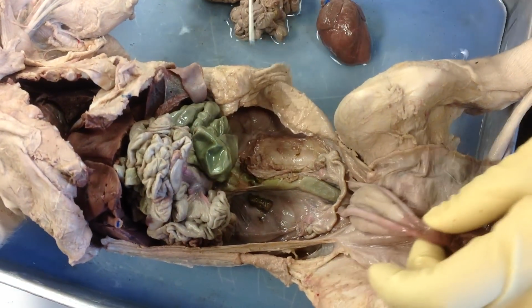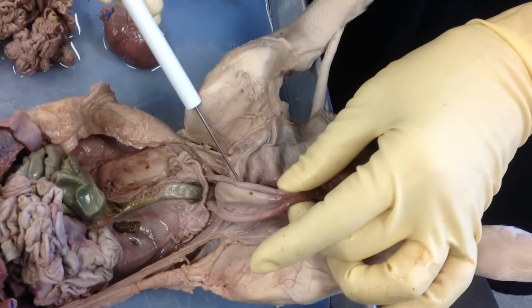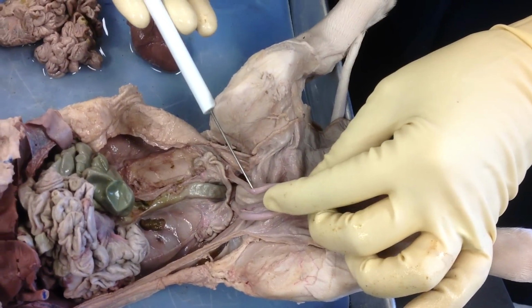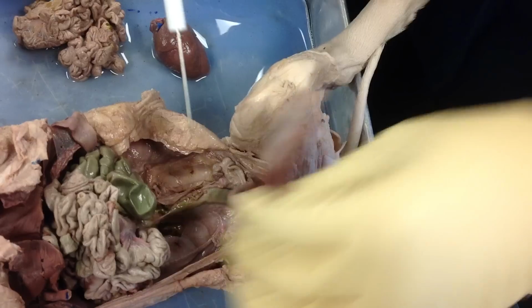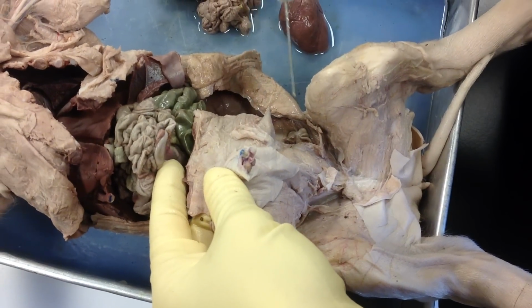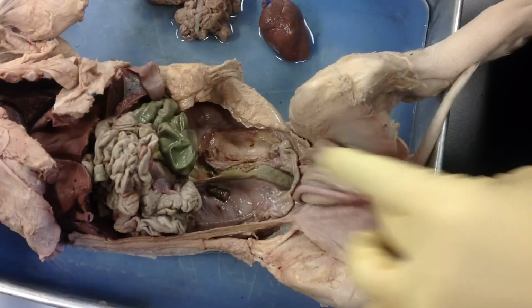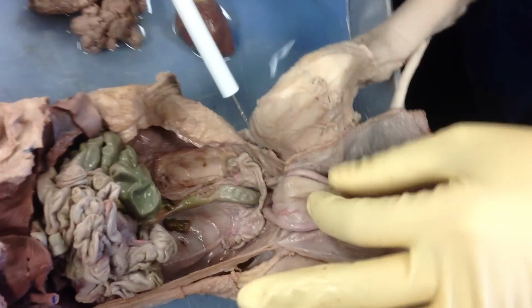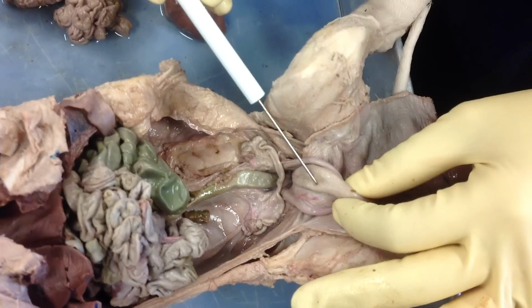And then if we look on here, I've got a red colored, either a vein or an artery. And remember, if it's red, what is it? It's an artery, okay? So these are my umbilical arteries, or there are two. These are my umbilical arteries and one umbilical vein. So if it's blue, it's the umbilical vein. If it's red, it's the umbilical artery. And then between the two umbilical arteries, of course, is my urinary bladder, okay? This is the urinary bladder.